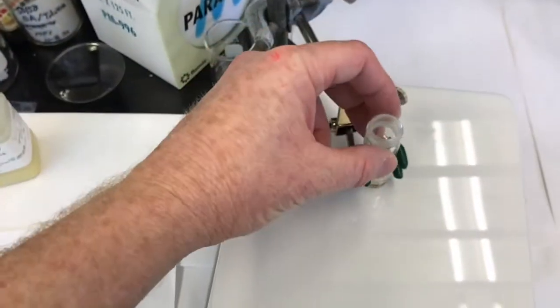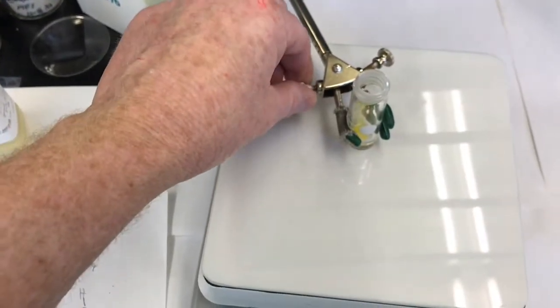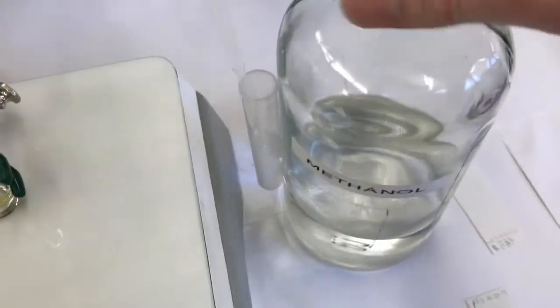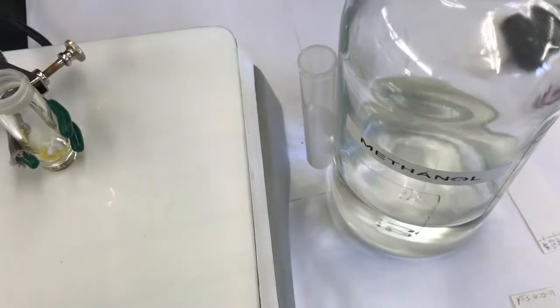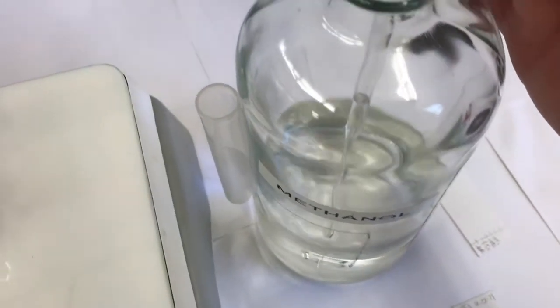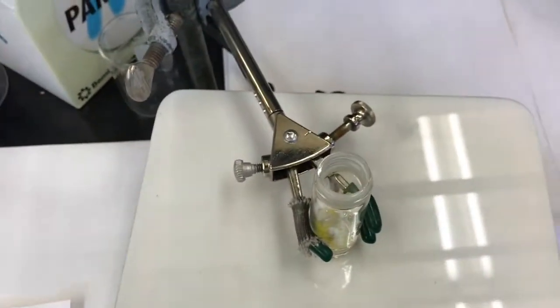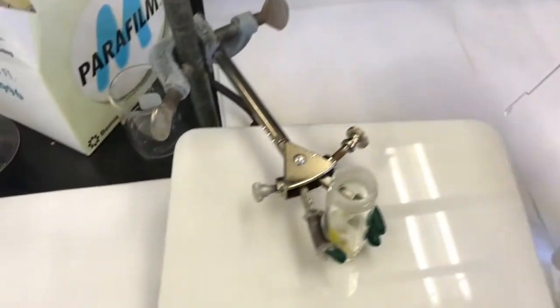And I'm going to clamp it on the stir plate again, and fill it with methanol to a volume of about 4 milliliters. Before I do that, I took out my spin vane, so I'll add that back in. Here's the spin vane, pointy side down, and get some methanol. I'll just pipette it in, it's only 4 milliliters. I'll draw some up, push it out, draw some up, push it out so it doesn't shoot all over the place on me. Okay, it's looking pretty good, it's not too drippy.